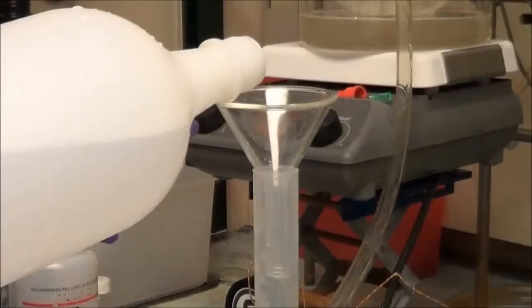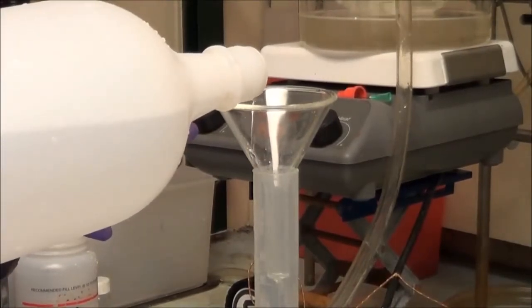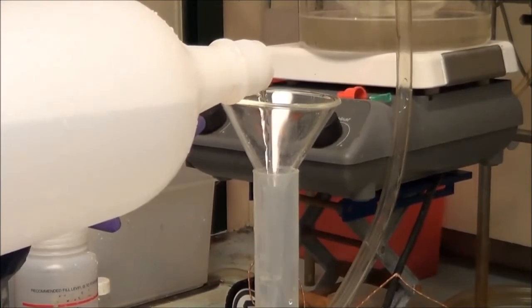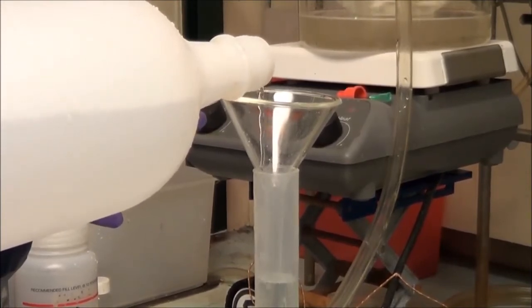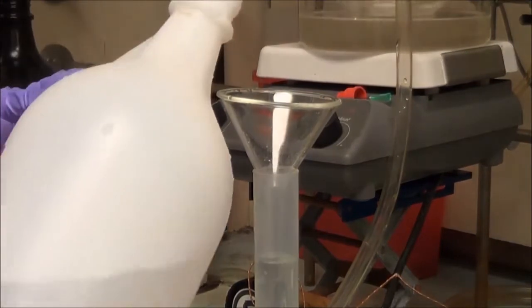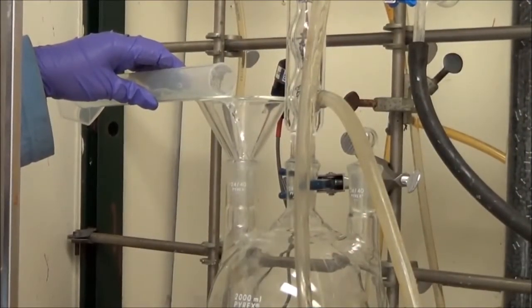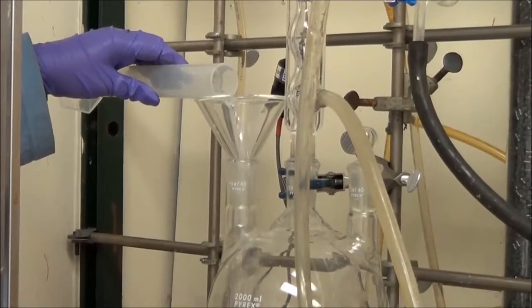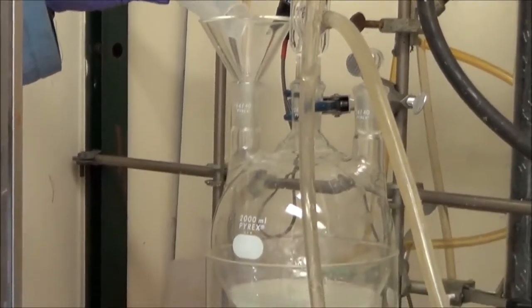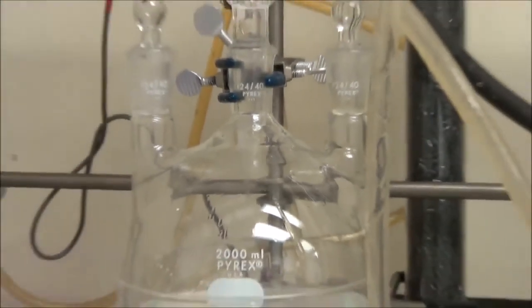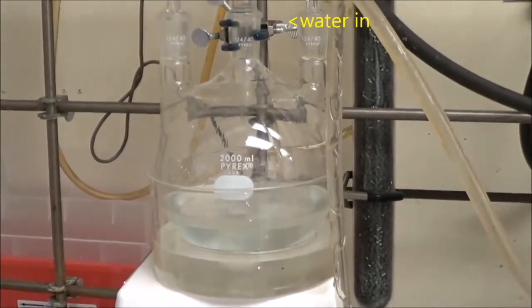The next step is the HCl reflux. You have to use concentrated hydrochloric acid here because phosphonic esters are much stronger than carboxylic acid esters. So unfortunately you have to use concentrated HCl. Here we are carefully adding the right amount into the round bottom with the product. It's hard to see here, but they don't actually mix too well. Another thing we're going to do, because we're going to be refluxing essentially a liquid, we have the condenser connected to a water cooling jacket. You absolutely need to do that.